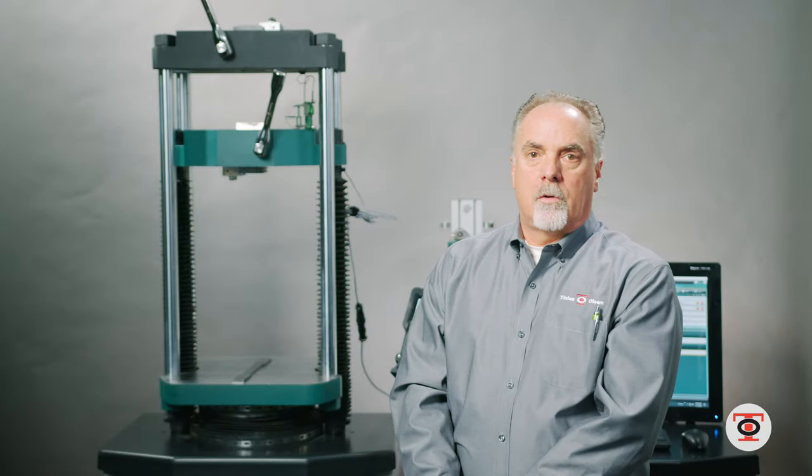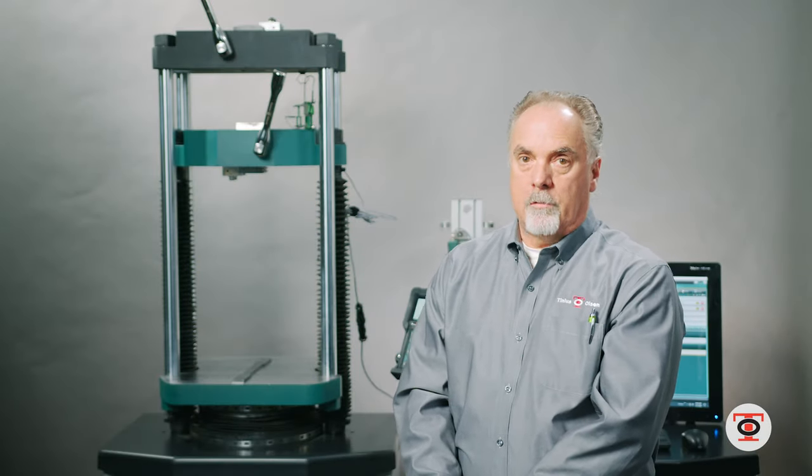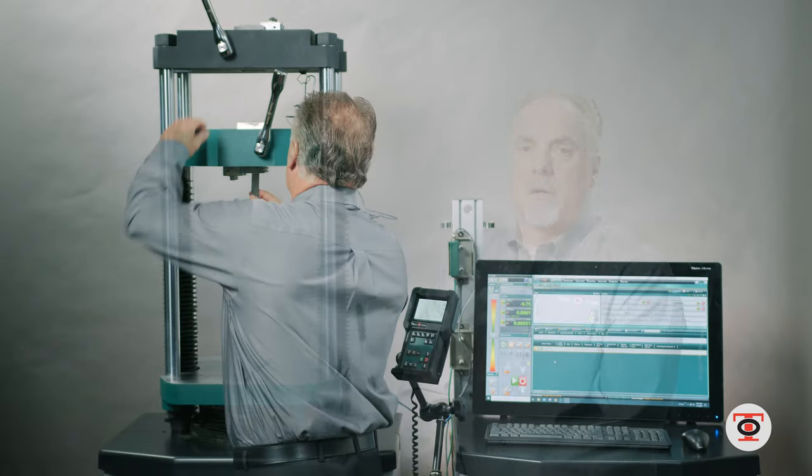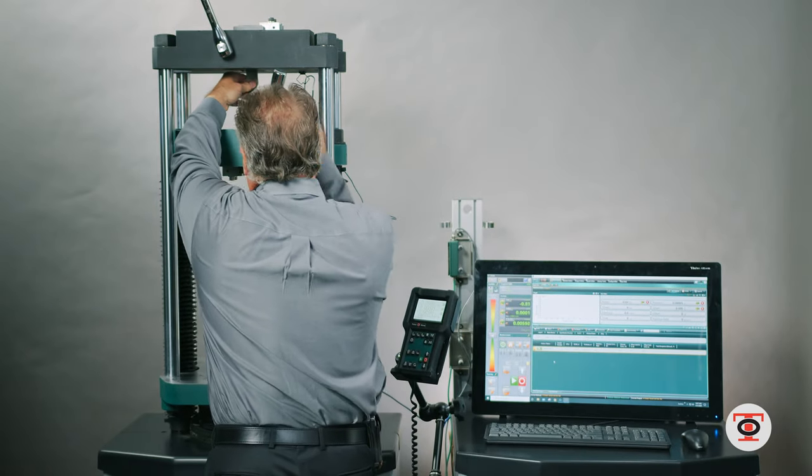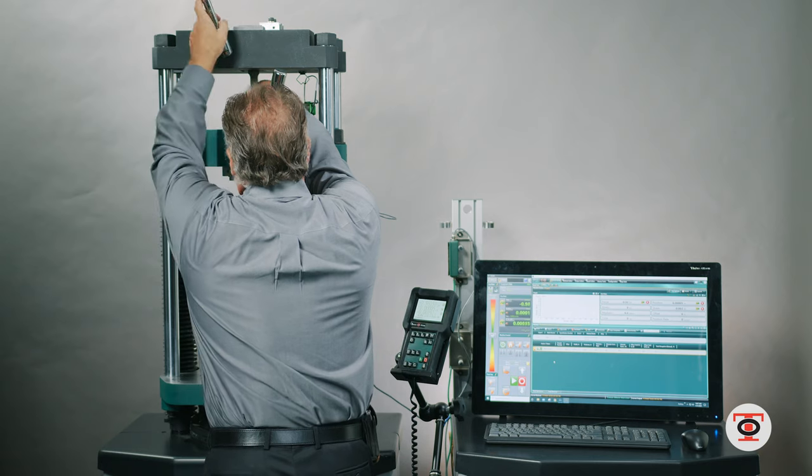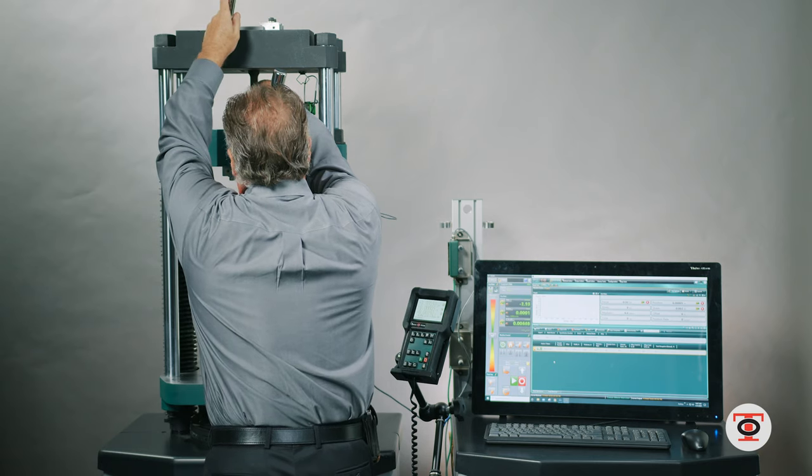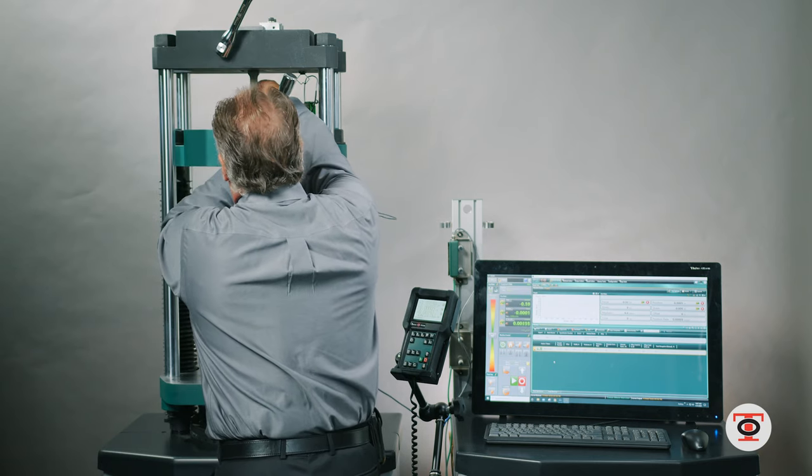I'm going to run a test with a flat specimen using the rack and pinion grips. You want to make sure that your sample is straight up and down, centered in the grips. Good practice.